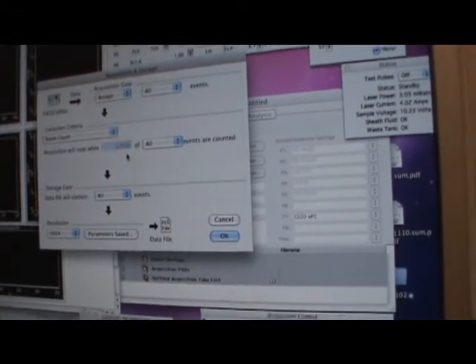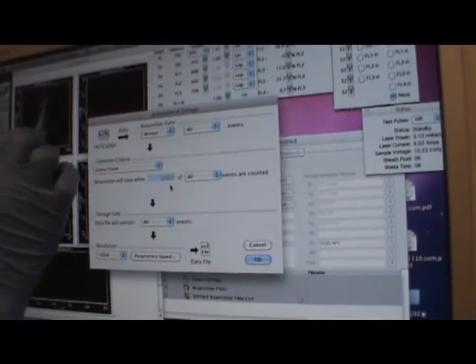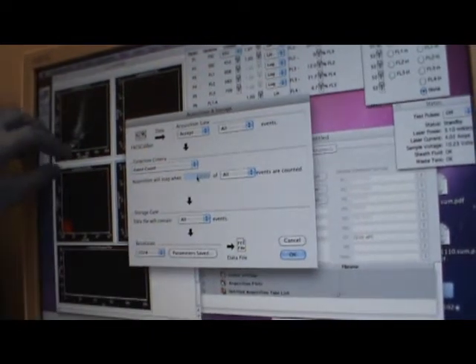Suppose I say I want in this gate only 50,000 events. So 50,000 plus it could be another 150,000 with all this. I don't care, but I need at least 50,000 in this. So the instrument keeps working hard. If you say acquisition will stop at 10,000, including everything, you might not get the population you're targeting for the number you're looking for. So it's very important to tell the instrument what you want in your gate, and how much. Then it will keep pushing for that many events irrespective of what it has other than the gate.